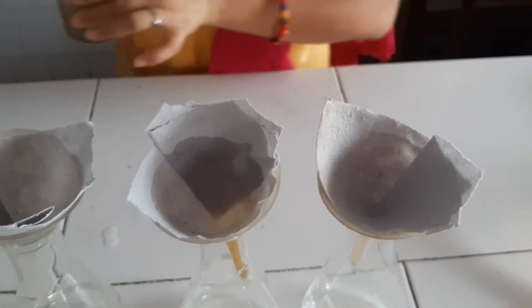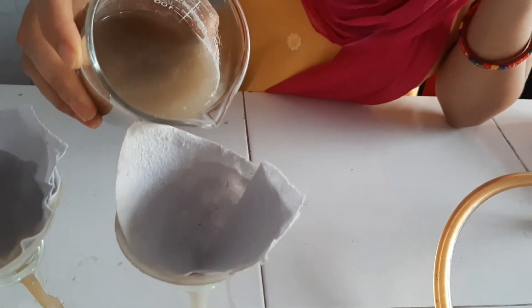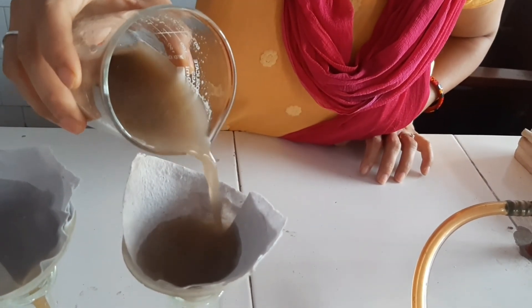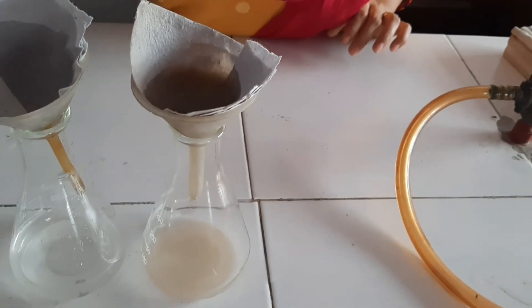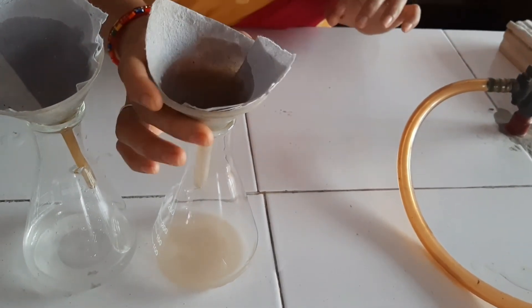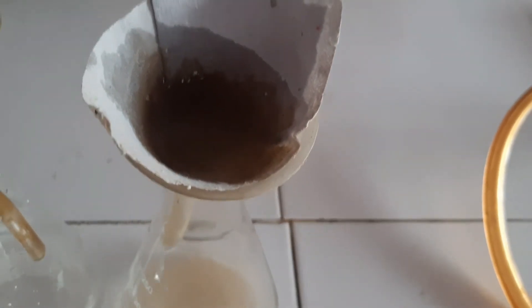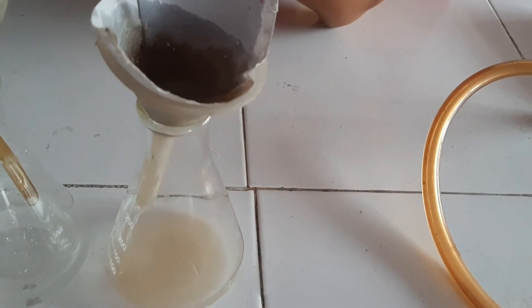Now let us see in case of suspension. We will check if anything is left on the filter paper. We will see that sand particles will remain on the filter paper as residue, and water will pass out as filtrate. The particle size of sand is quite large, so it takes some time to filter. You can see that the sand particles have remained on the filter paper and the water has passed out.